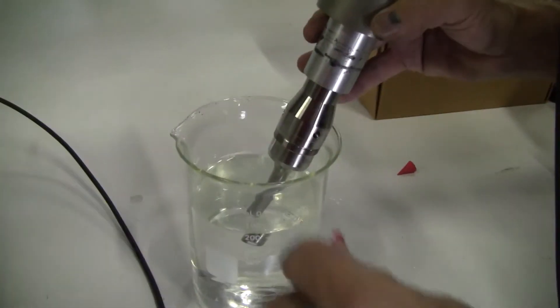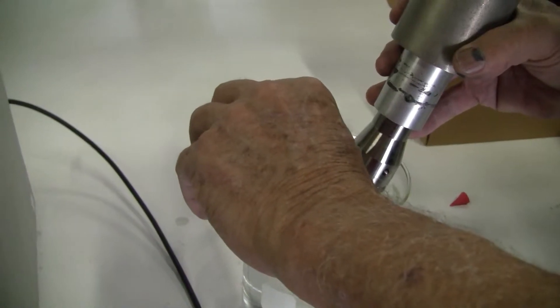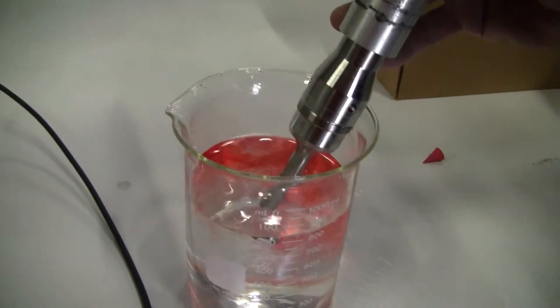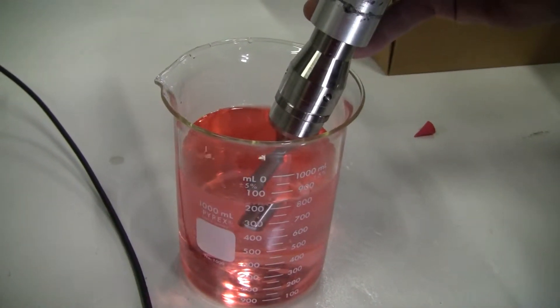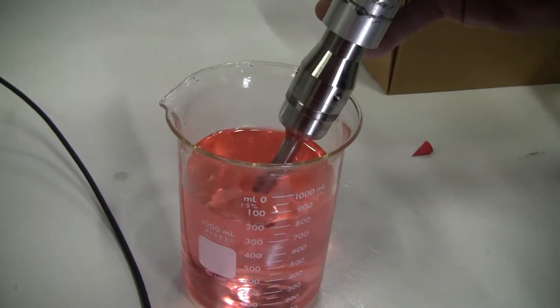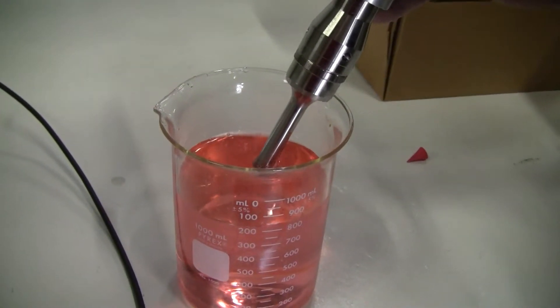You can hear it going. Now we're going to put some dye into the water. See how quickly it works. It shows that the tip is sonicating.